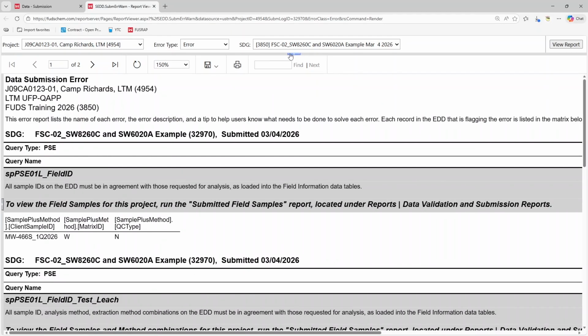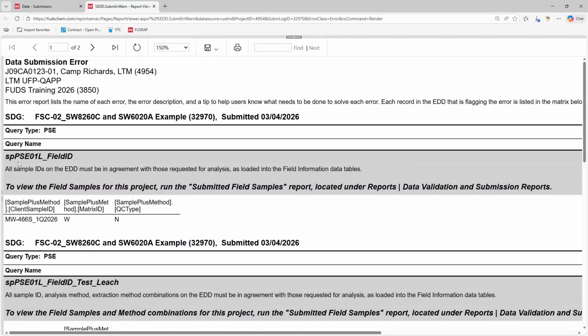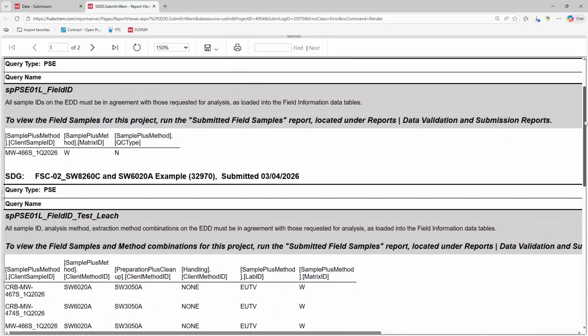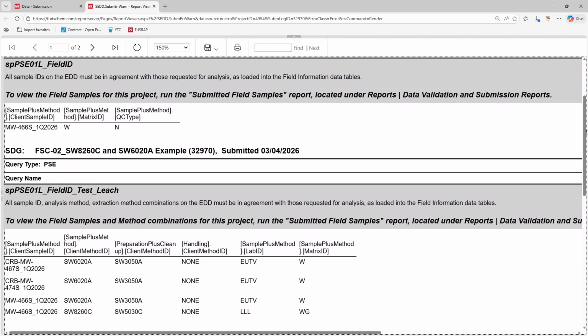Let's look at the spPSE01L field ID and spPSE01L field ID test leach errors. Oftentimes, these two errors are caused by the same thing, and solving one will solve the other. The error report tells us that the samples in the SEDD must agree with the ones requested for analysis in the field information tables.